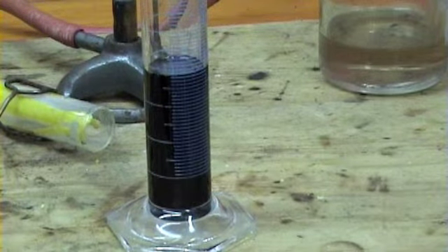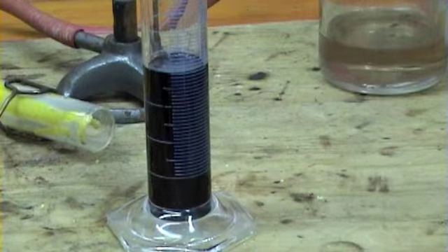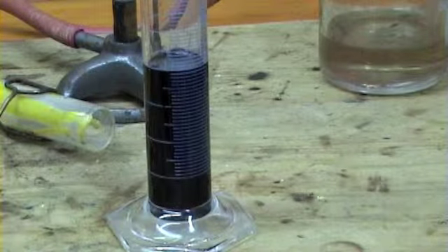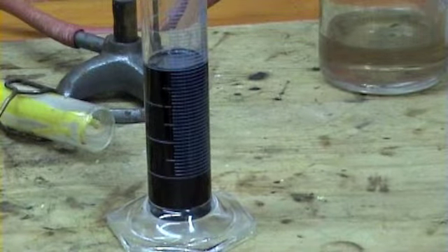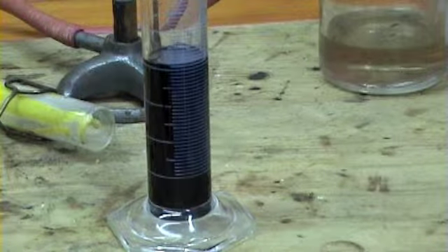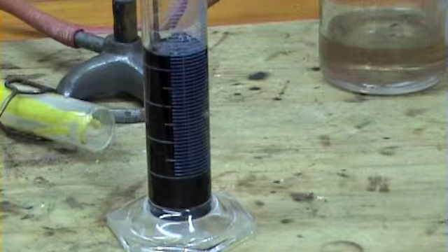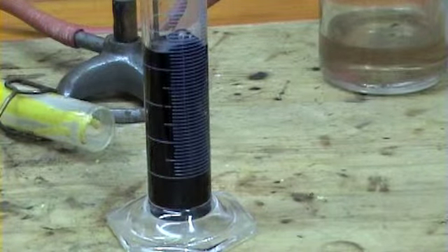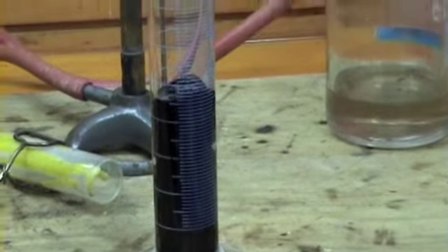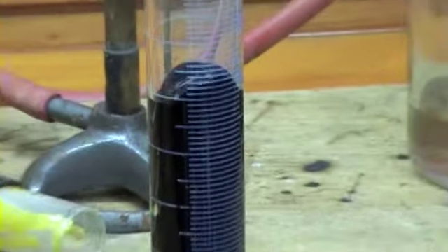It's a bit hotter now. Is it just me or did the volume increase? Yep, the volume's starting to increase. Okay. There we go. And that's actually boiling in there now. Might have to zoom out. So how hot would that be now?